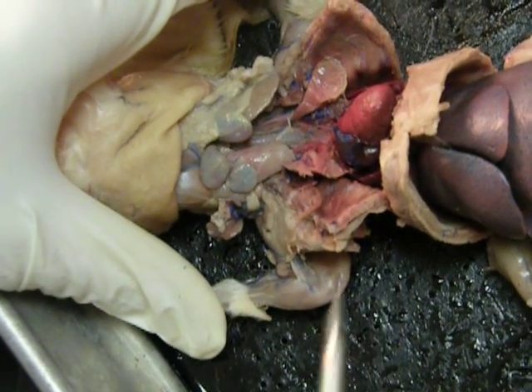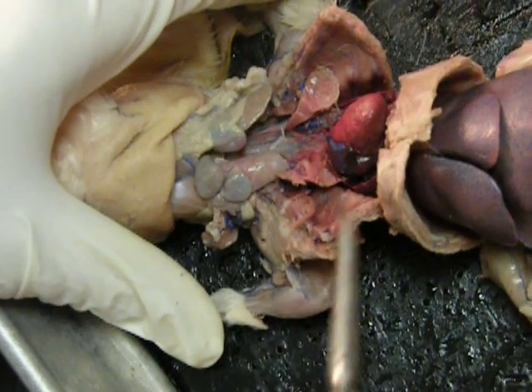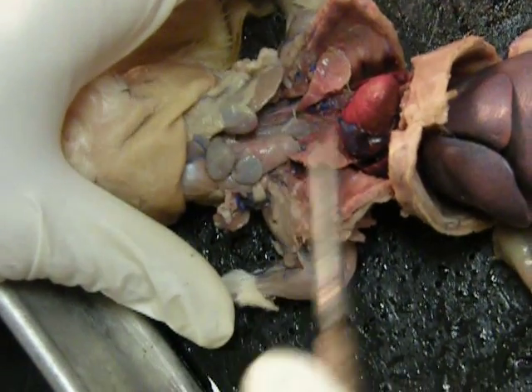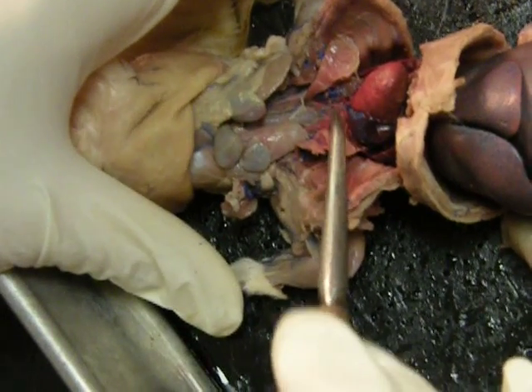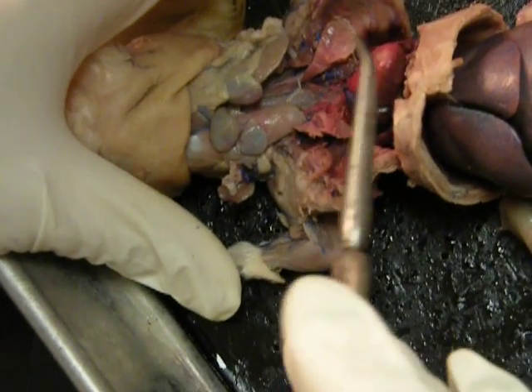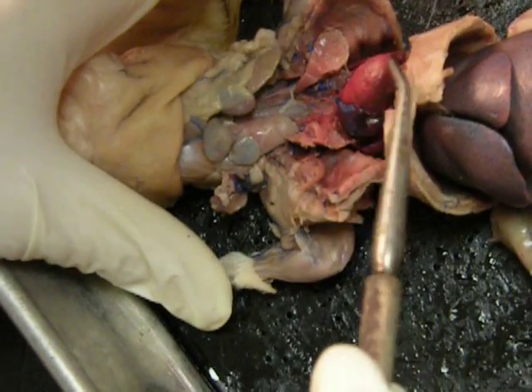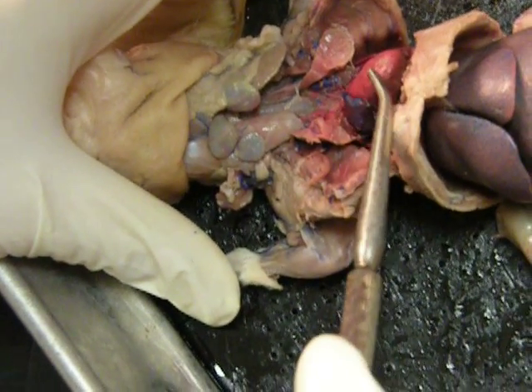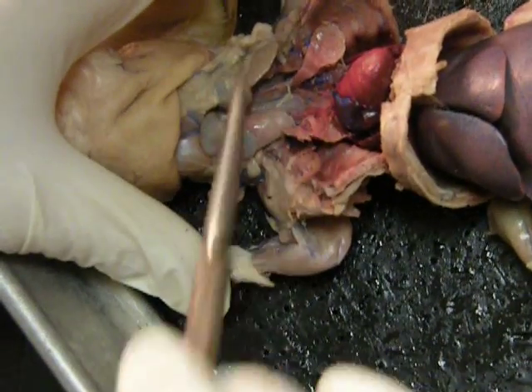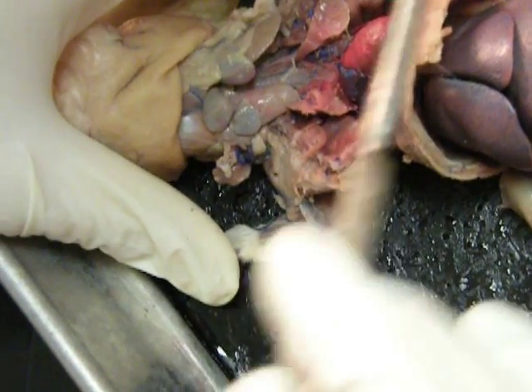This is the thoracic cavity, and we went ahead and cut through it. The first thing you want to deal with is your different cavities within the thoracic cavity. So you have your pericardial cavity, and you have your visceral pleura, which is always on the organs. The shining surface on the organs will be your visceral pleura. And then we broke the pericardial parietal pleura.